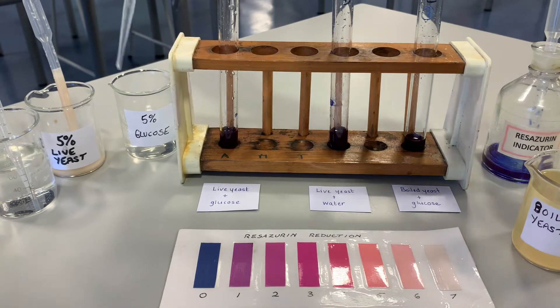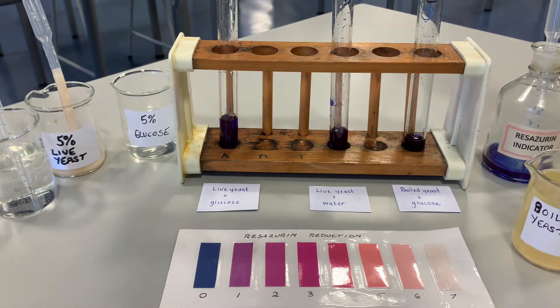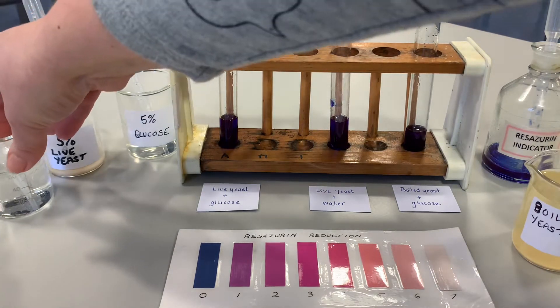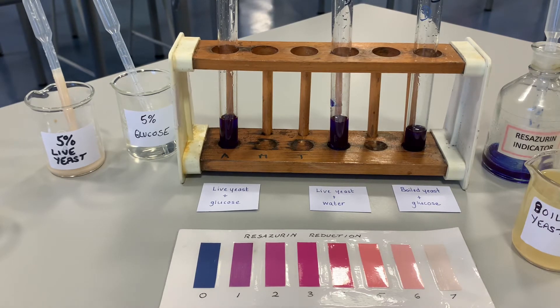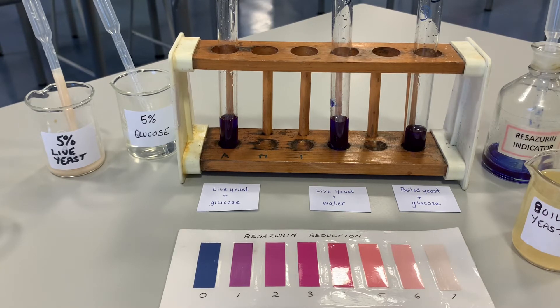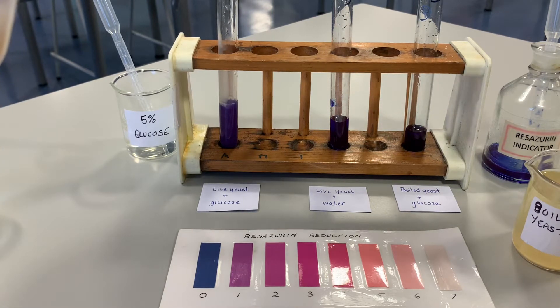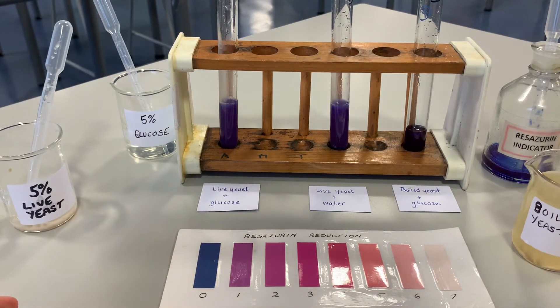We're going to add equal volumes of glucose to each of the relevant ones. This one here is live yeast and glucose, this one is boiled yeast and glucose, and into test tube B we're going to add water. Then into A and B we're going to add the live yeast, and C is going to get the boiled yeast. Once we've done that, I'm going to transfer them into the water bath at 35 degrees, start a stop clock, and note the color change and roughly at what time it happens.